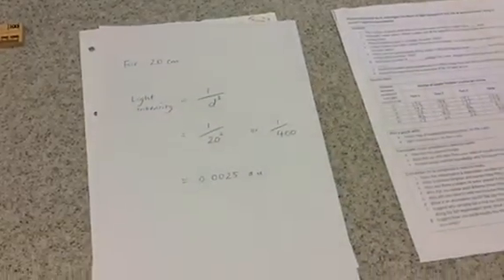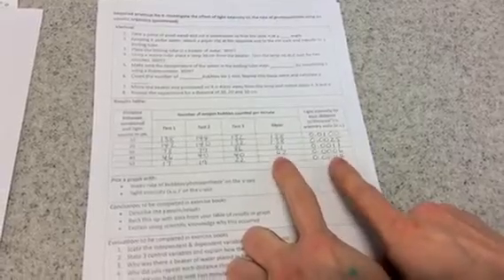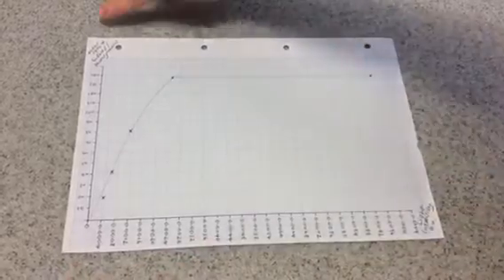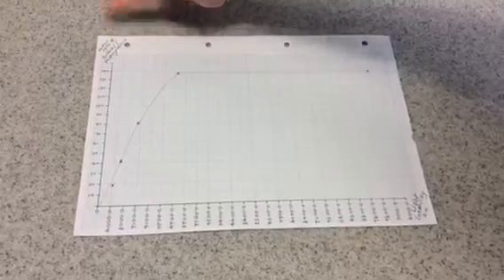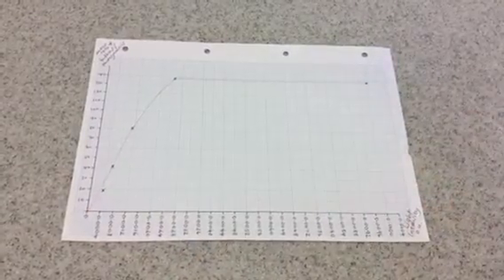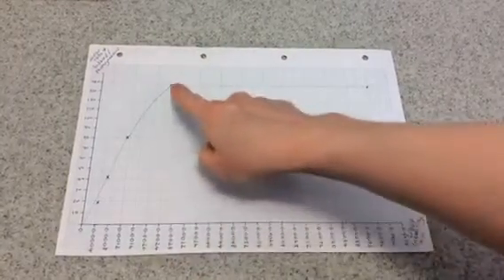Now you'll see here, I've popped down all my calculations for each distance, and then we're going to use these 2 columns and plot this on our graph. So we'll go over to our graph. Okay. And you'll notice I've got light intensity along the bottom, I've got the mean rate of bubbles, or actually the rate of photosynthesis up the side, and I've plotted those, and you'll see as light intensity increases, so does the rate of photosynthesis, or the number of bubbles produced. But you get to a certain light intensity and actually the rate starts to level off.